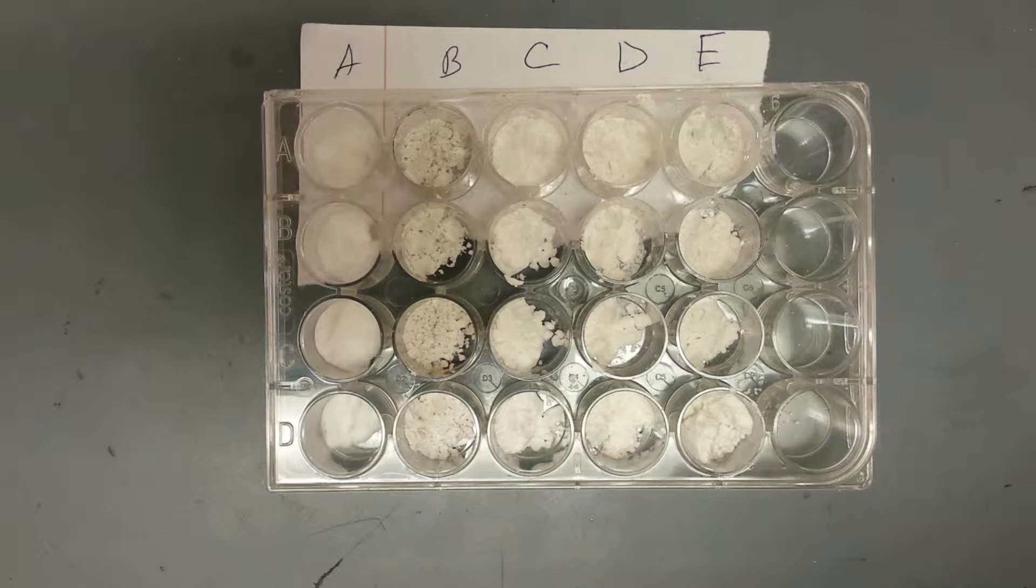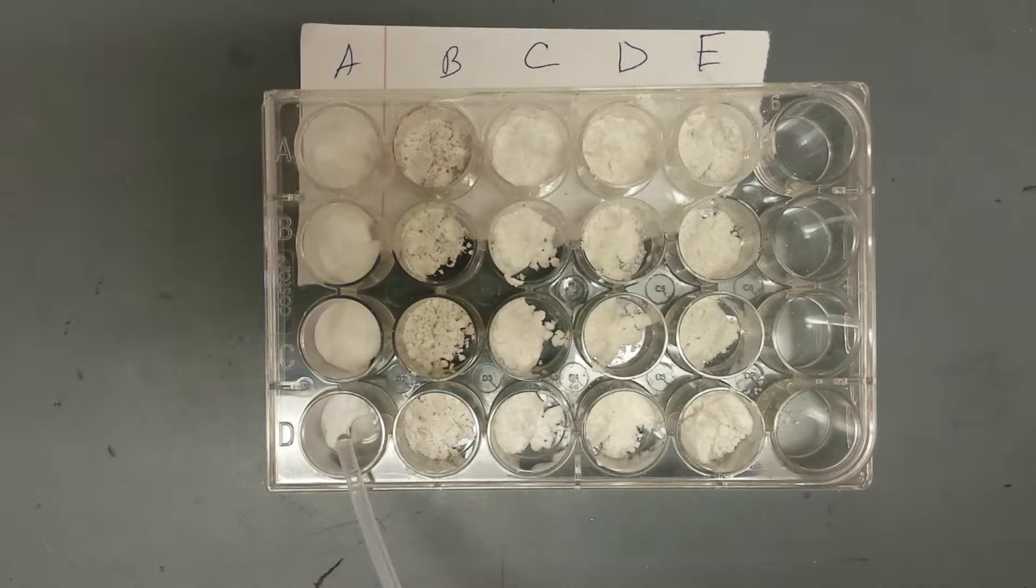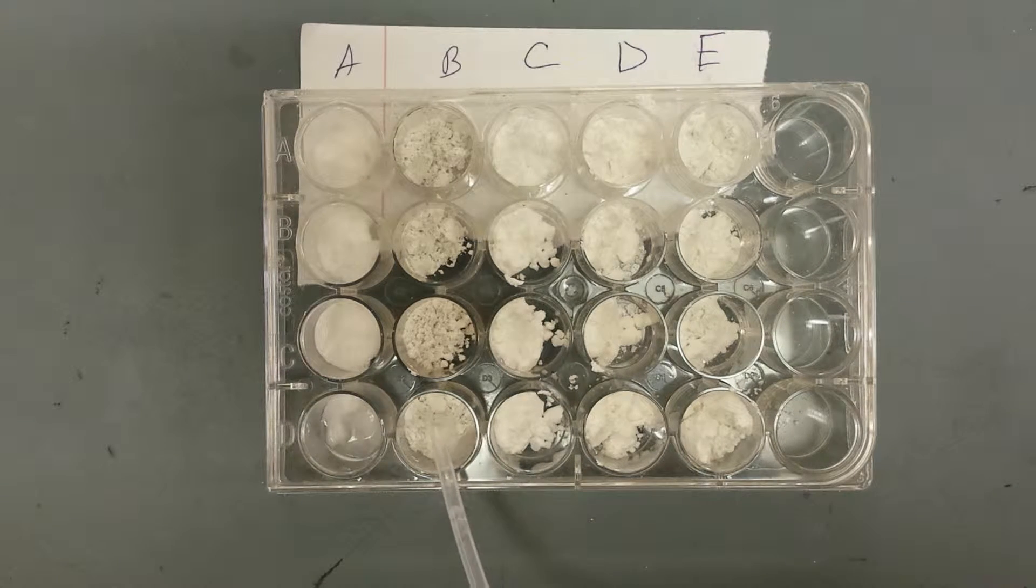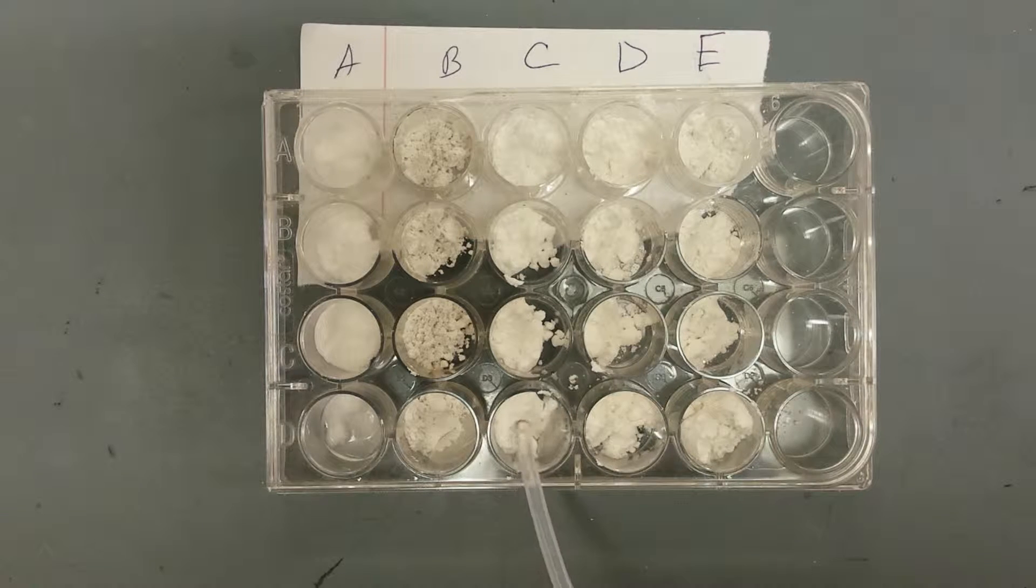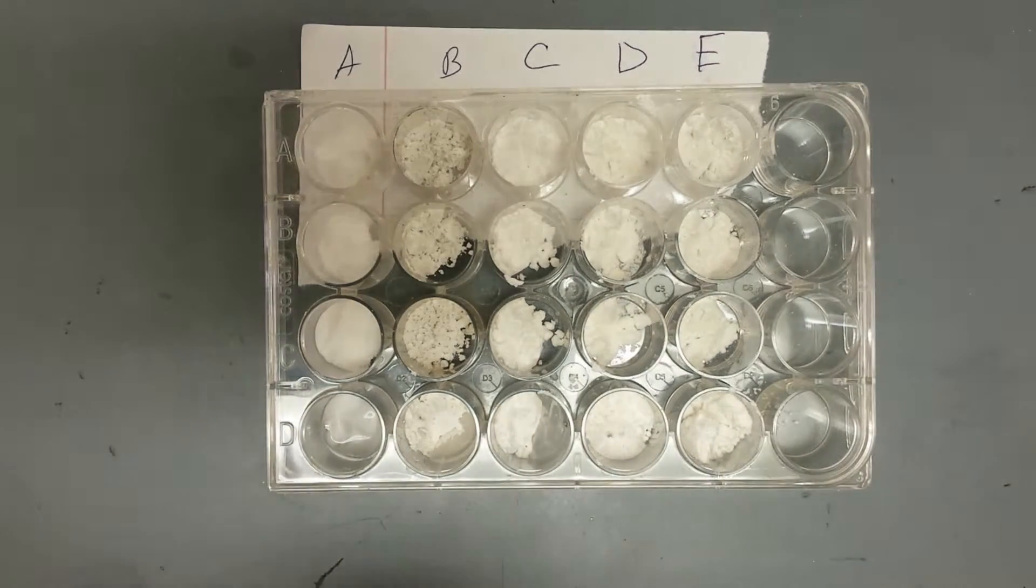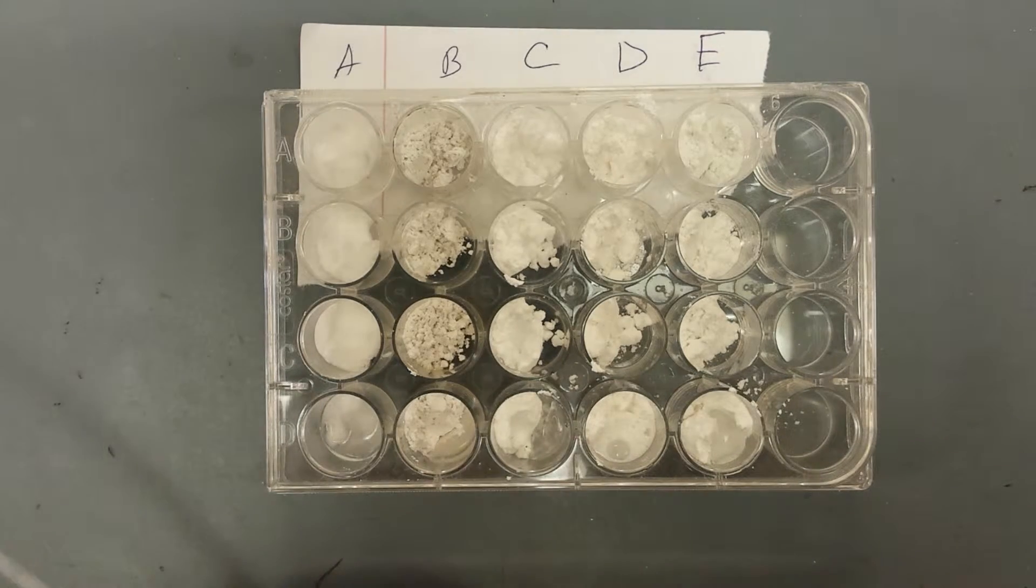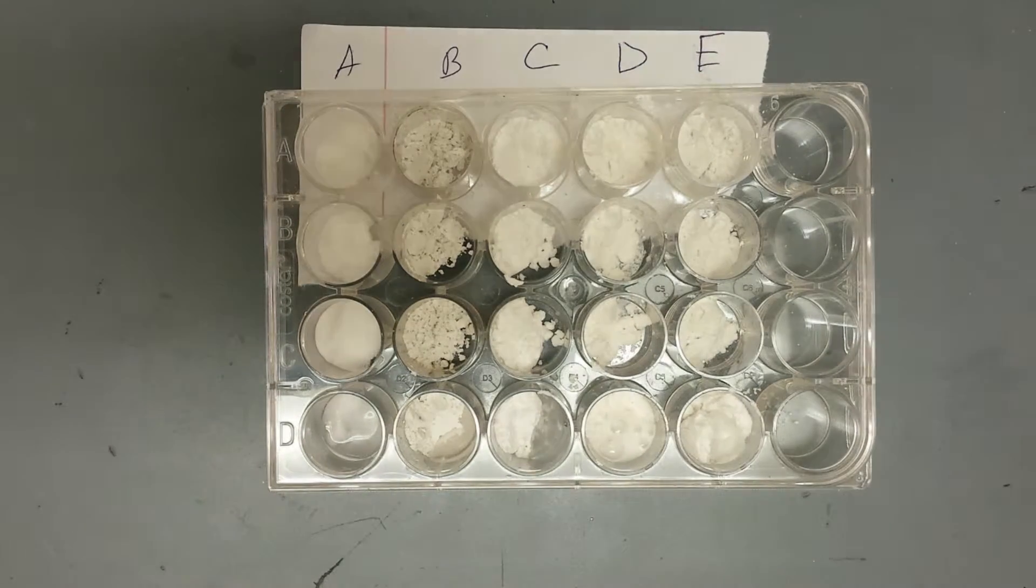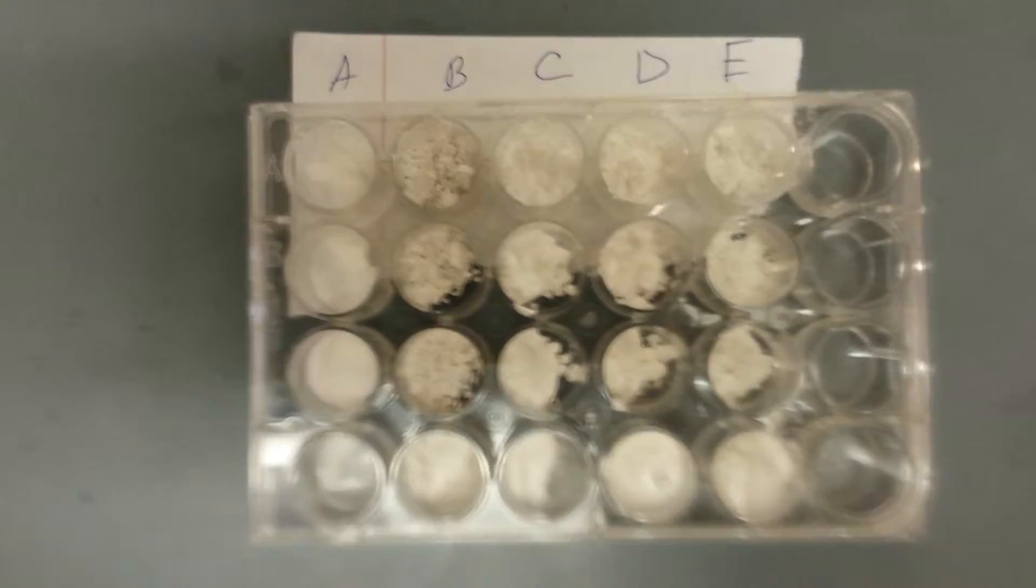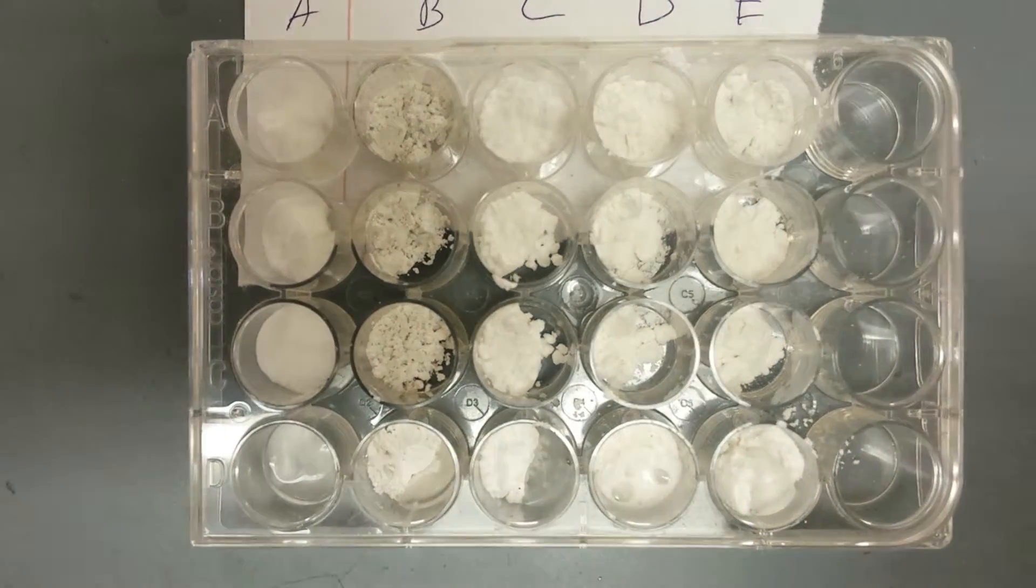So then we need the water. Let's just put that as the first row. How much of it do you want to do? Five drops. Whoa, that one's fizzing. Okay, so that's D. That scared me. Okay, so D and water fizzes.